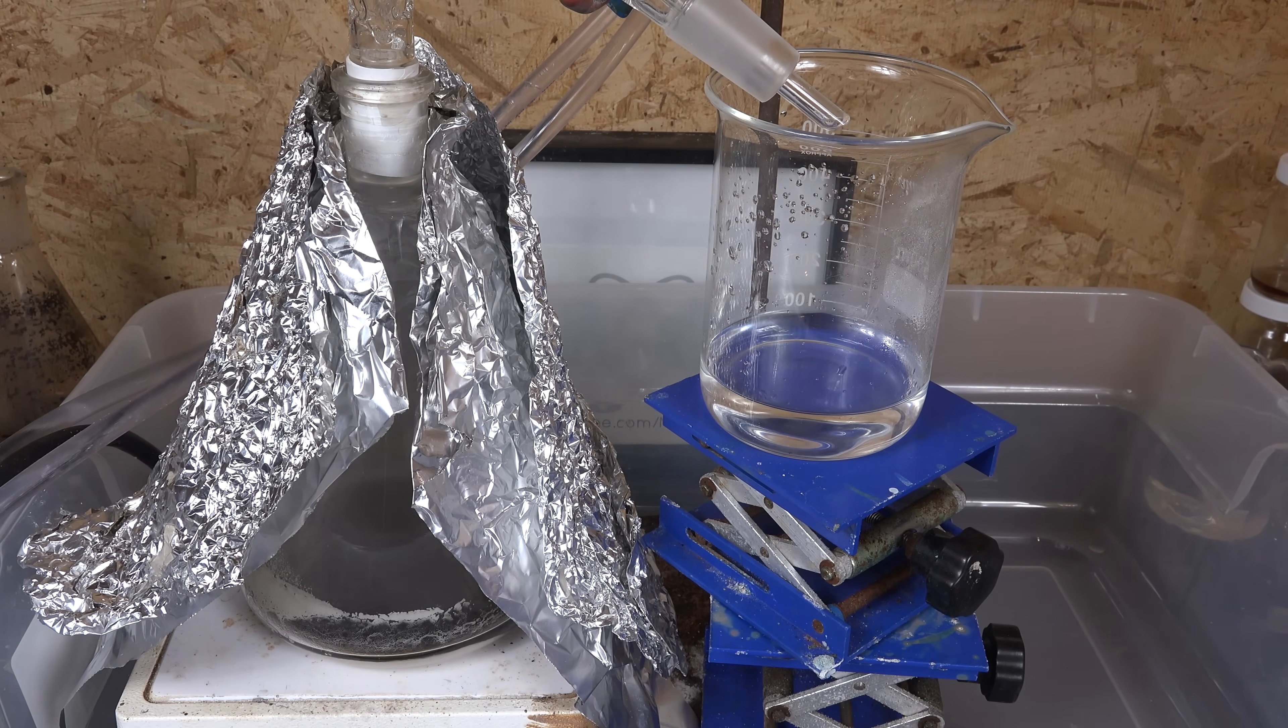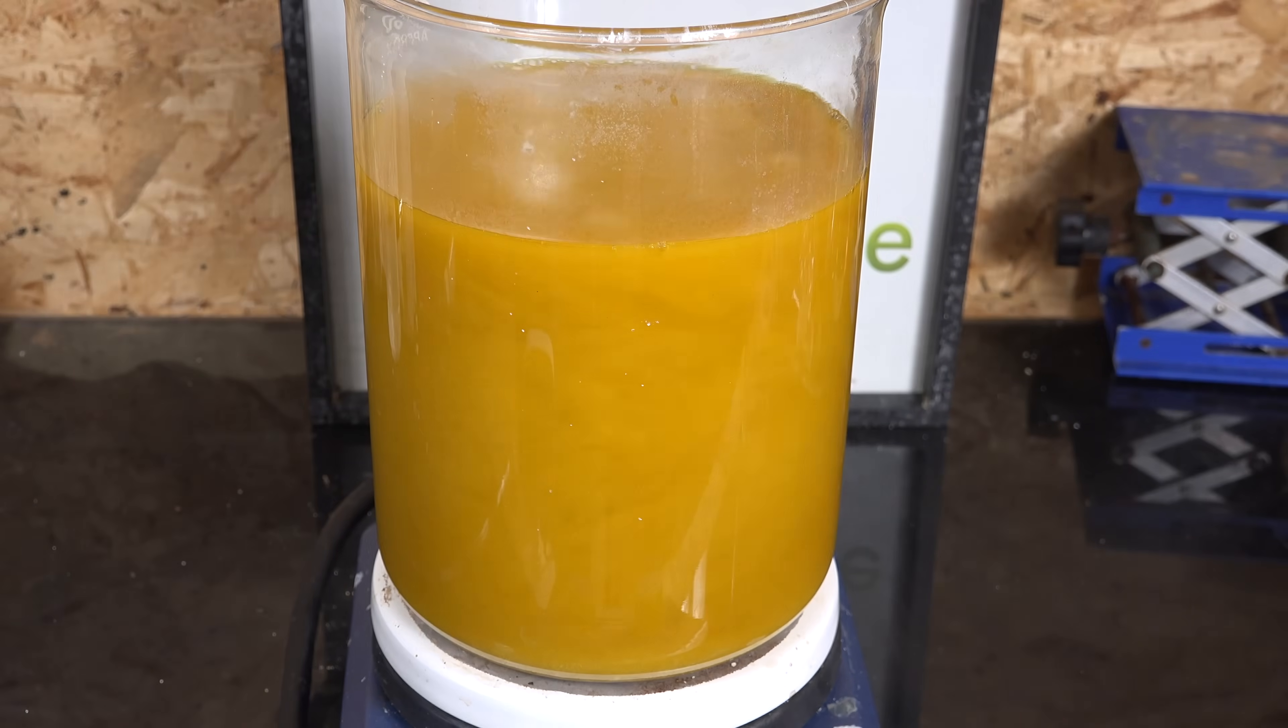In this video we are going to do it by a rather unusual process, oxalic acid precipitation.